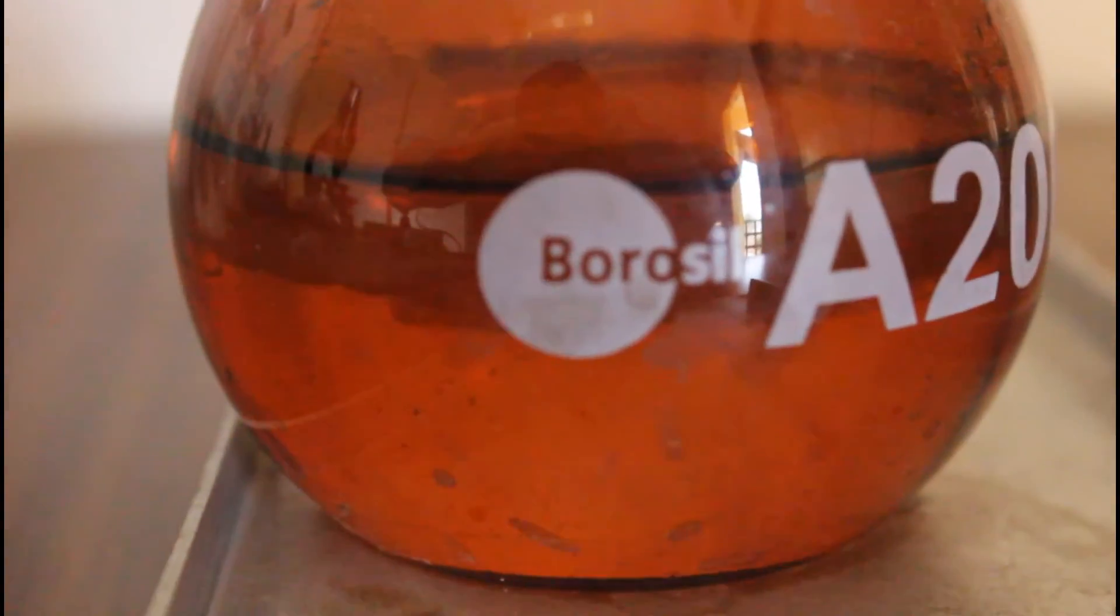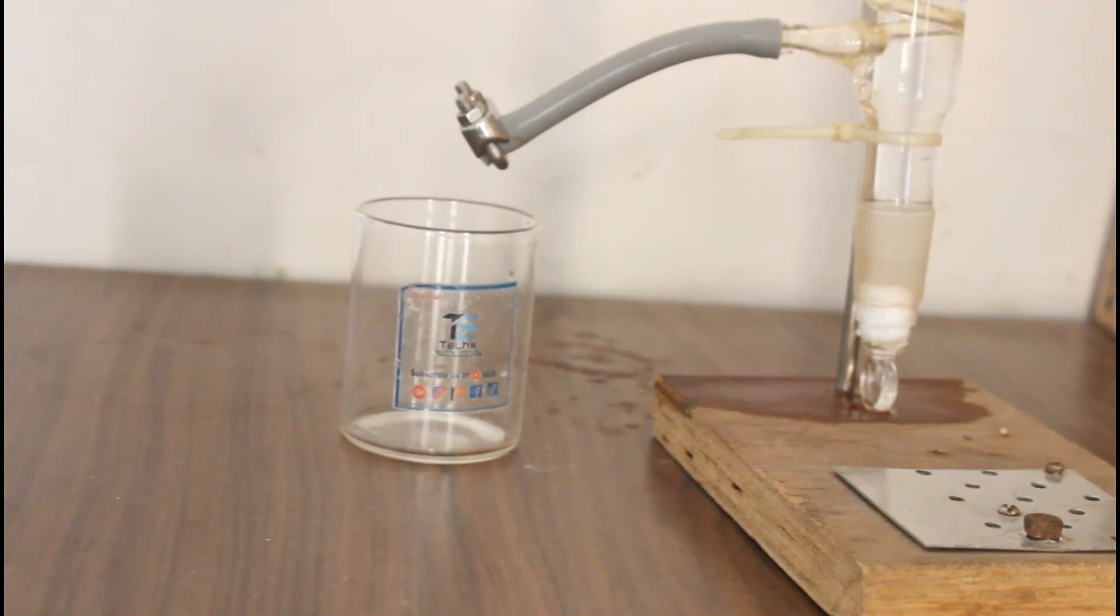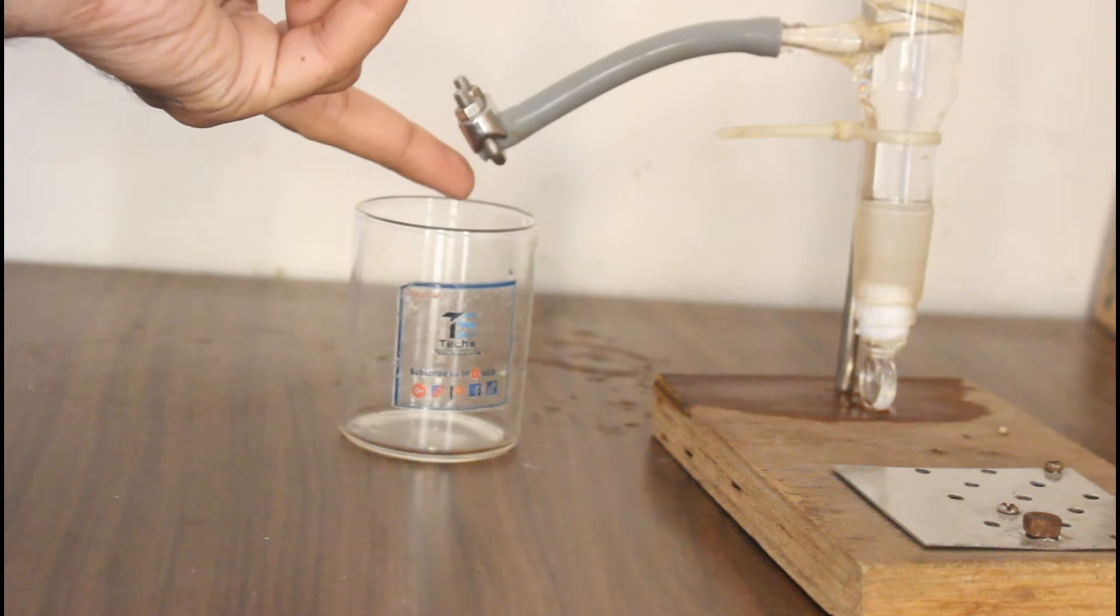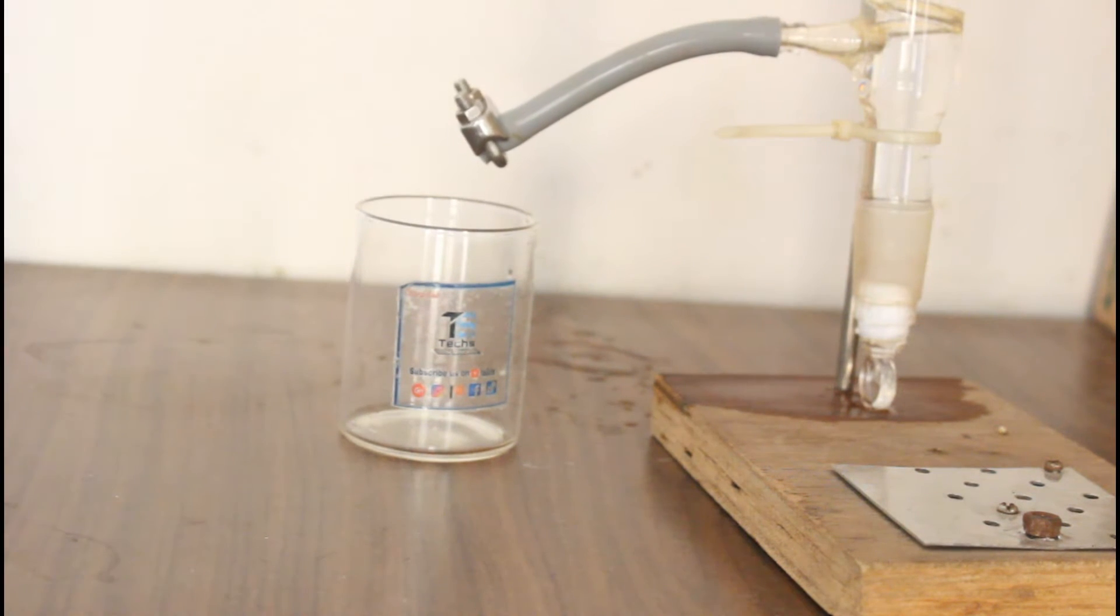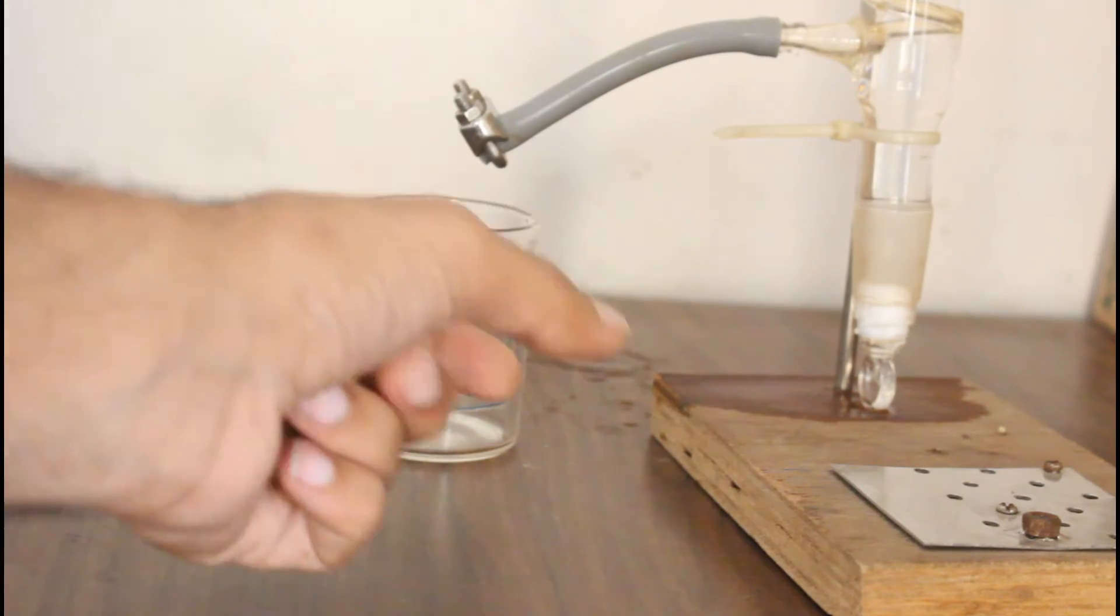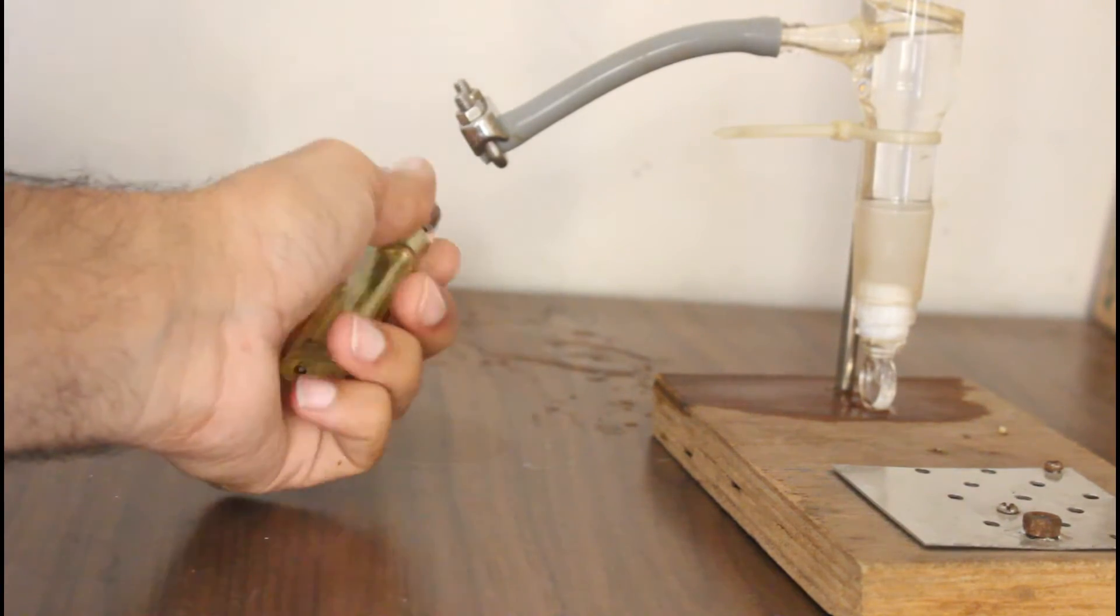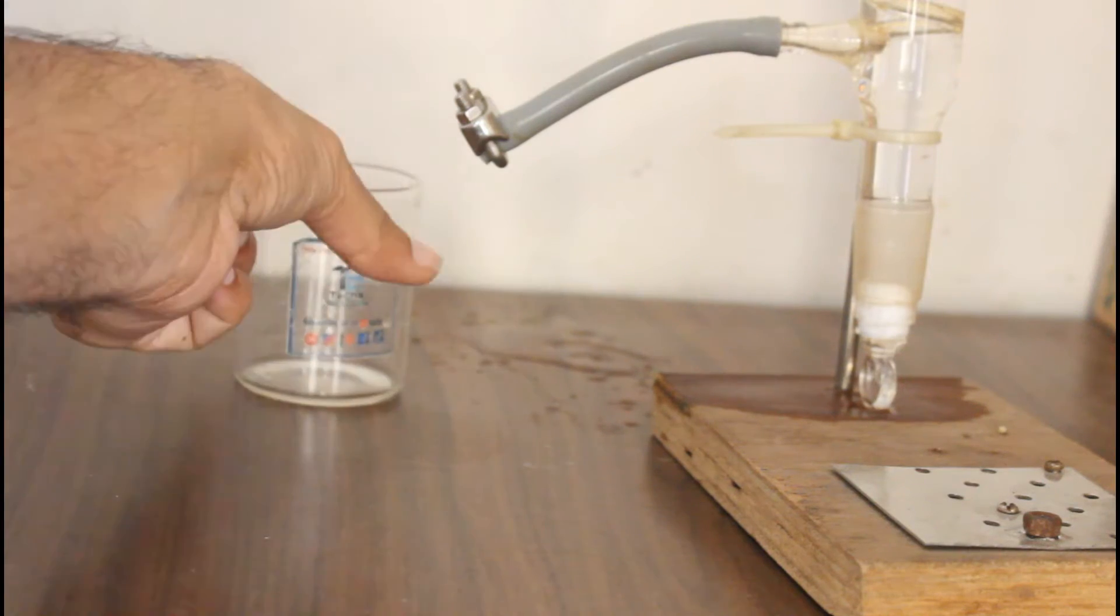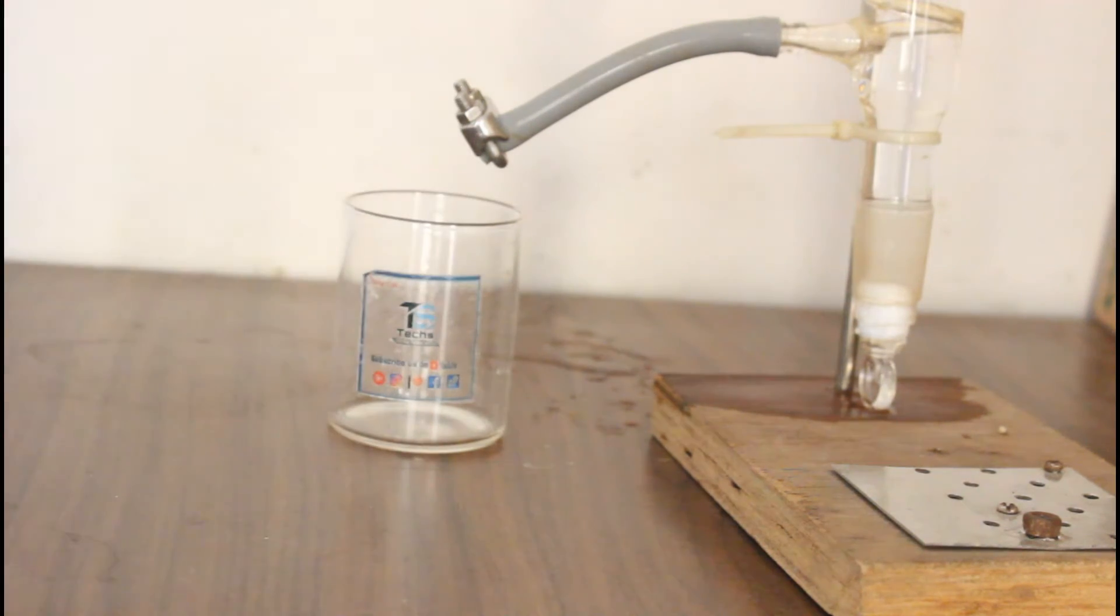Even after 10 minutes I can't see any drop. Maybe it's not getting condensed. Let me see if you get flames. No, it means we are not getting any product. Actually the process is quite slow, maybe because of this low temperature.